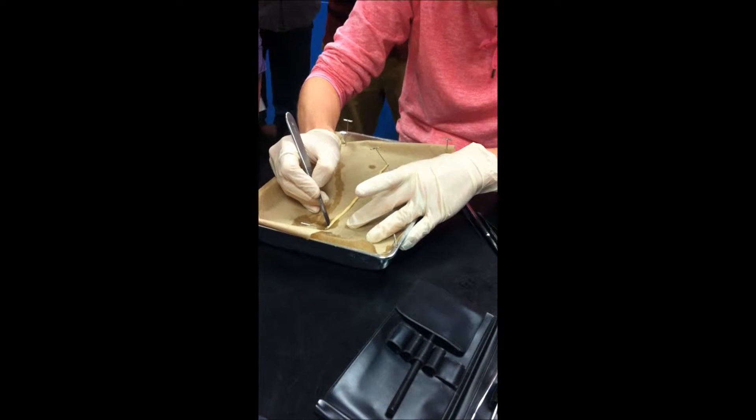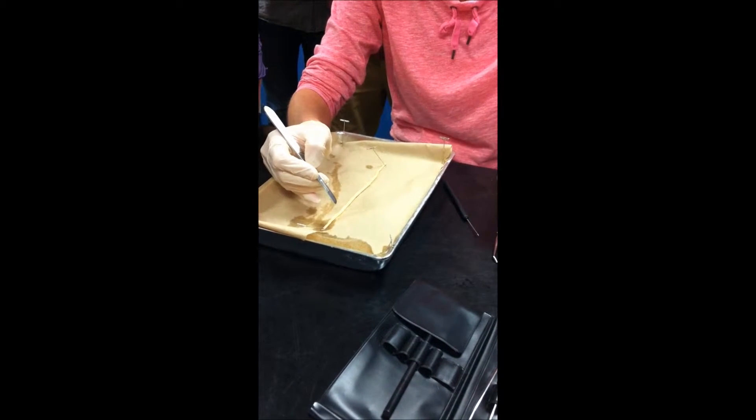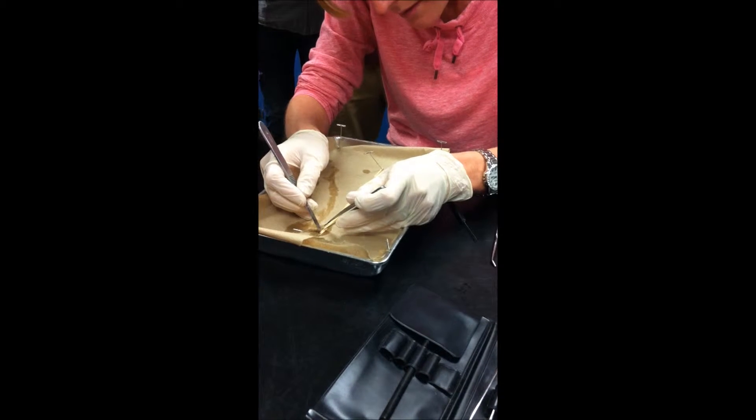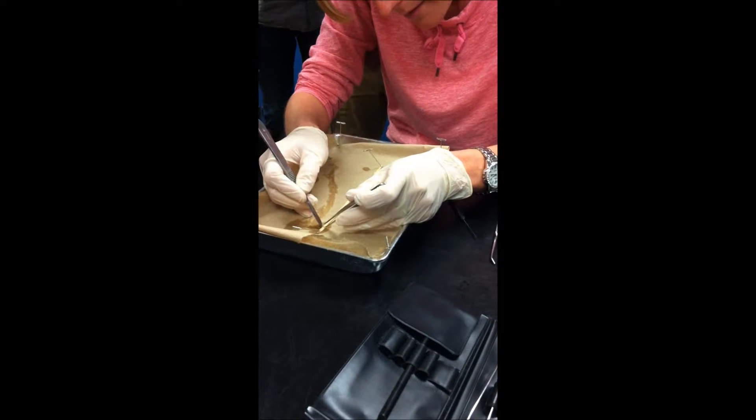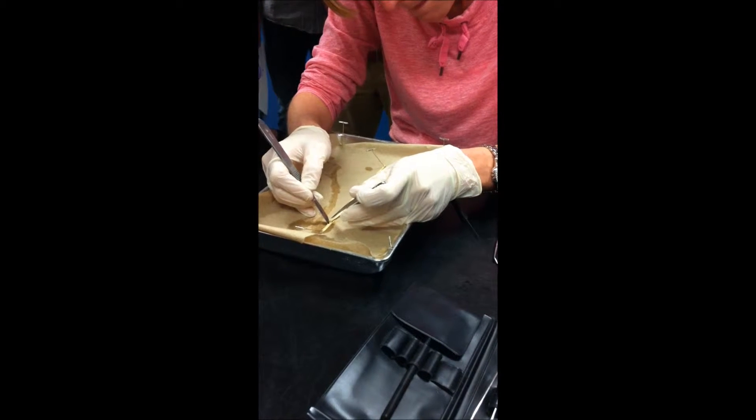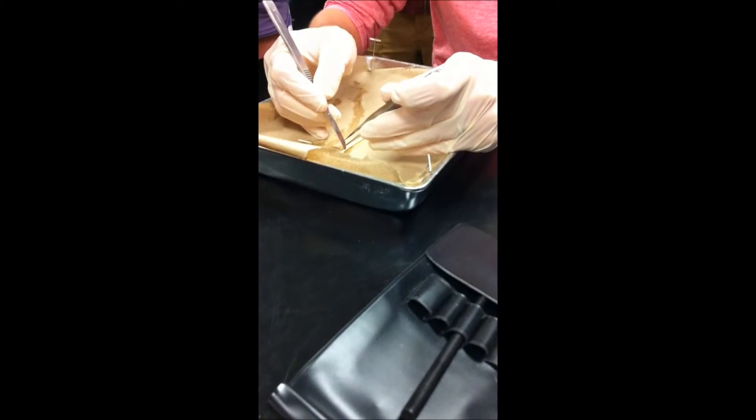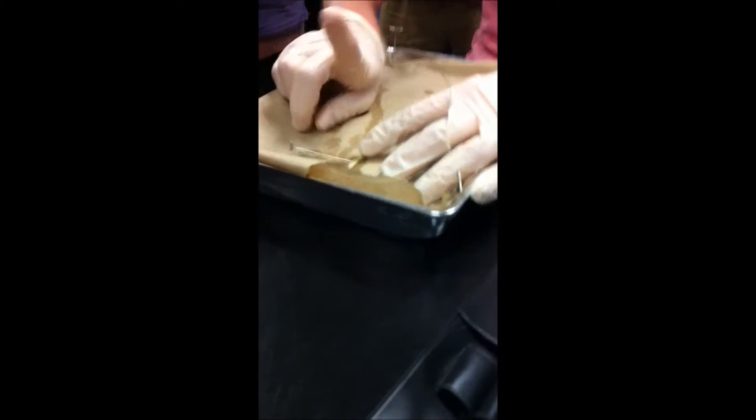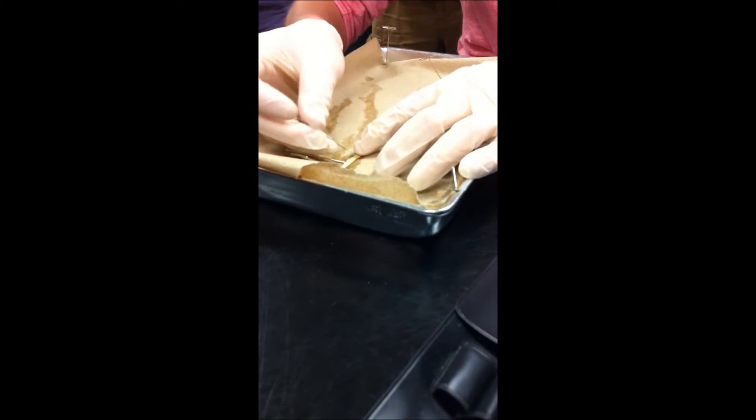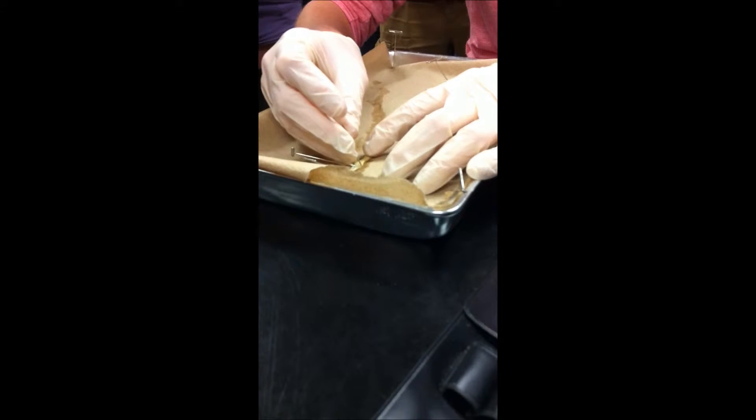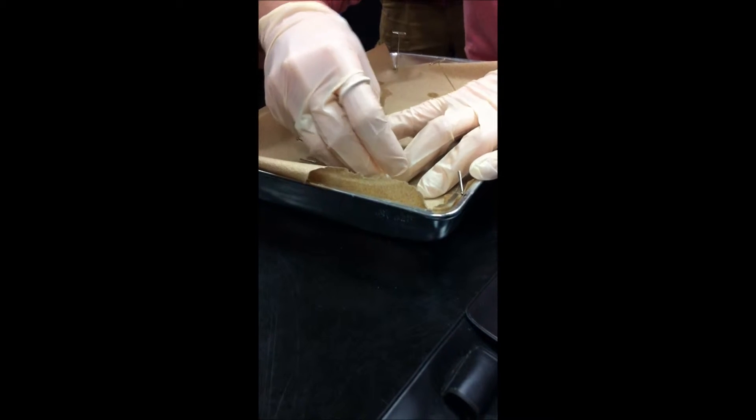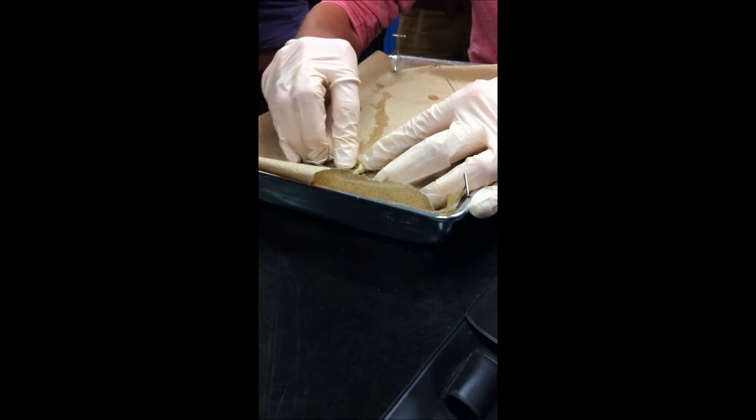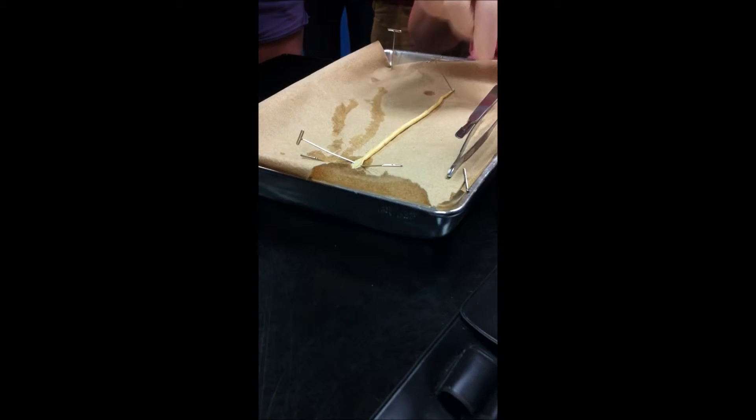Very gentle. You can see I'm already through the first little bit. So, as I go, I'm going to pin open the skin. Now, a couple of things about pinning. Notice how my pin is off to the side. It's not vertically straight up, and the reason it's off to the side so I can see what's happening inside. If my pin was straight up and down, I wouldn't be able to see anything, right? So, I'm pinning horizontally.